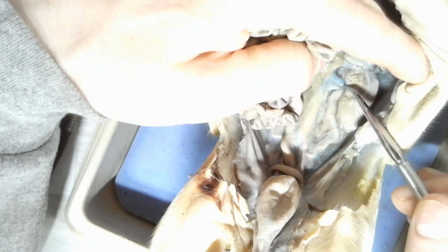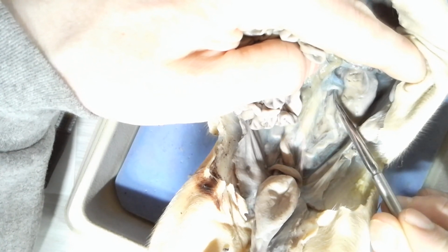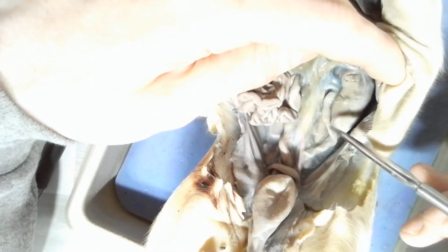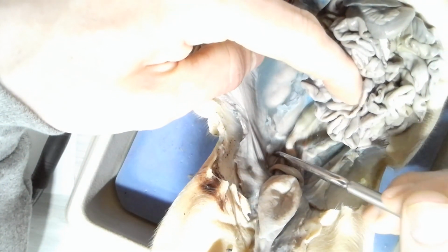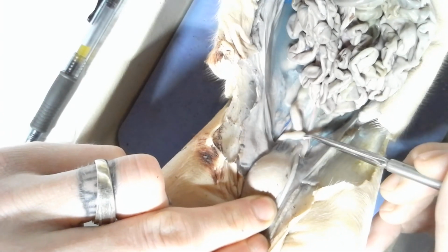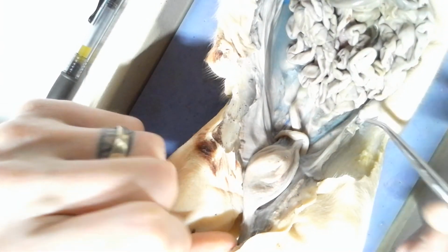You see two blood vessels going into the kidney. You see a renal vein, which is blue. The renal artery is clear. So renal artery, renal vein. Then you see this very long tube that comes up in the kidney. This is called a ureter. Okay, there's one on each kidney. So two ureters, one right here and one on the other kidney going straight down. And that's what meets up with the bladder. And then the bladder actually comes down to one tube called the urethra. And the urethra actually goes down to the urogenital area, whether it be the penis or the vagina, depending on what kind of gender your pigs are.